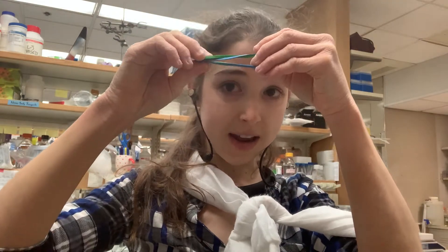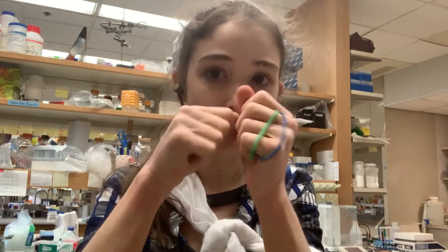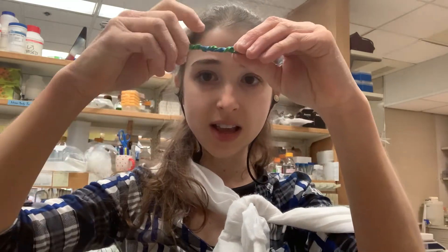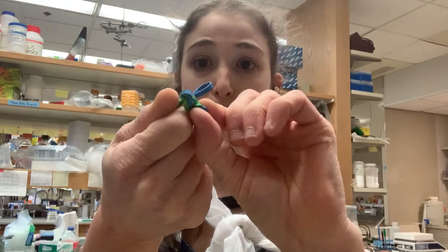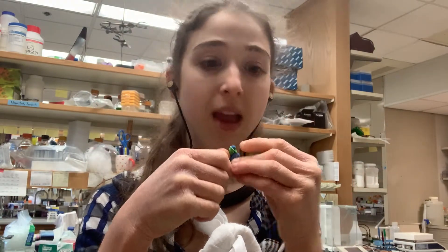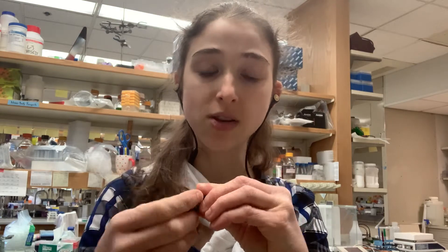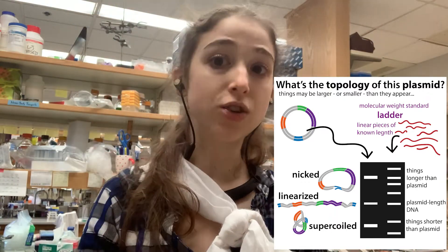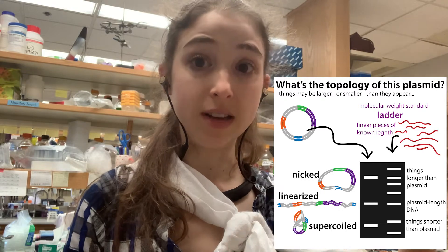But what if you just have the plasmid DNA as-is? DNA is humongous, so in cells it gets coiled up. In bacteria it gets really coiled up, and we can talk about supercoiling. If you twist a rubber band or telephone cord, it gets super duper twisted — this saves a lot of space and makes it really tiny. So when you run supercoiled DNA through the gel, it travels like it's a lot smaller than the whole linear strand, because it can just shoot through the holes in the gel. It travels faster and looks smaller — a lower band than you'd expect.